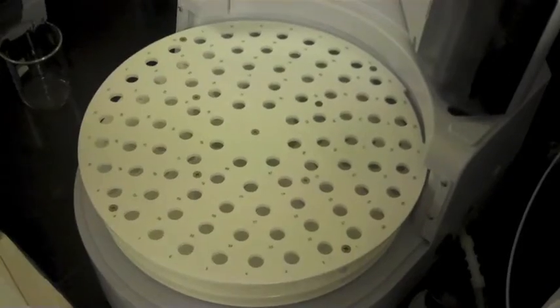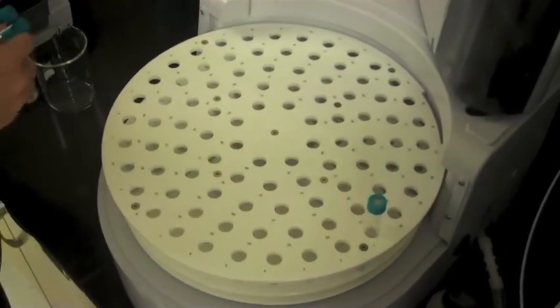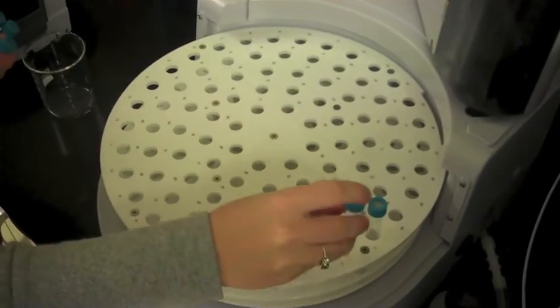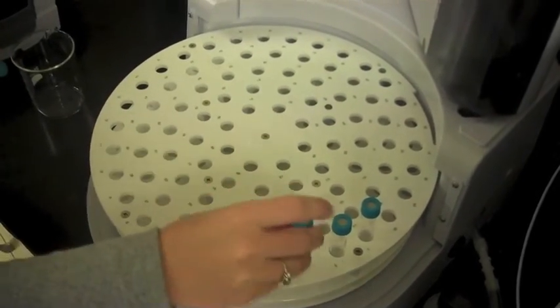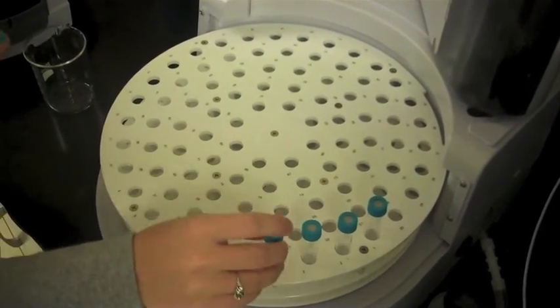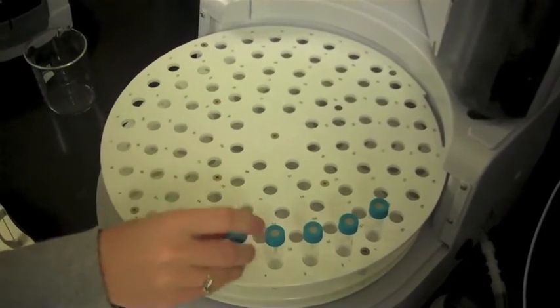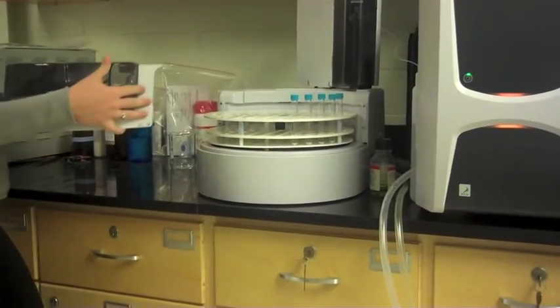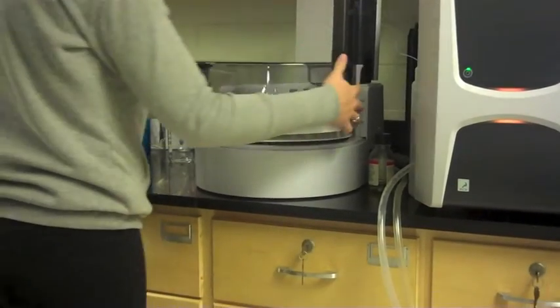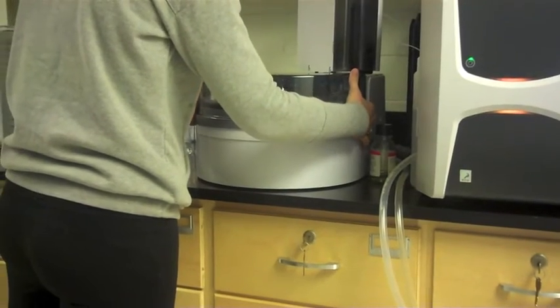The tray contained under the cover is numbered so that samples may be placed in order corresponding to the sample tables created on the program, which will be shown later. Once the test tubes have been loaded, the ASI cover must be replaced.